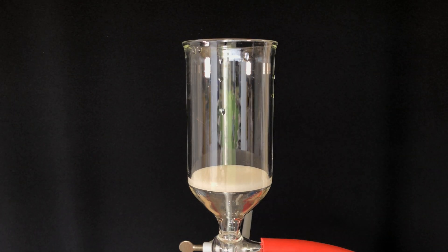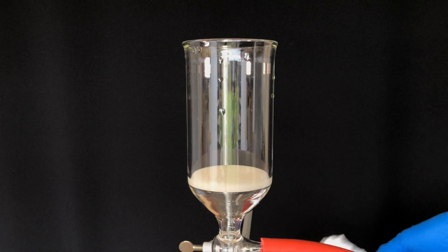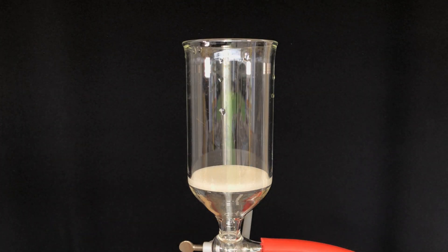How do you think we're going to do this filtration? Well, that's right, another vacuum filtration is best because I'm lazy and I don't want to wait.